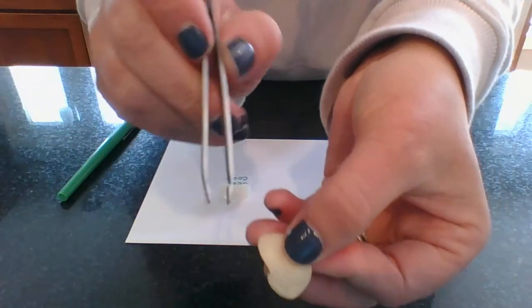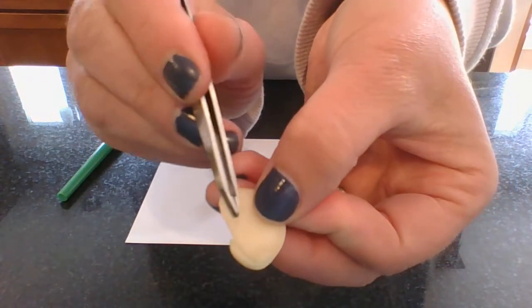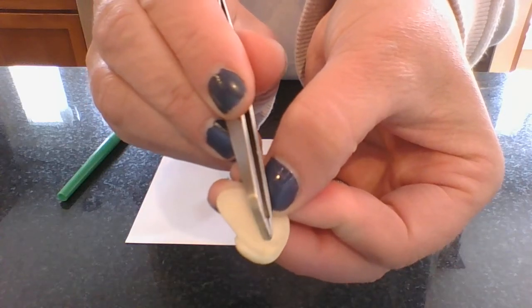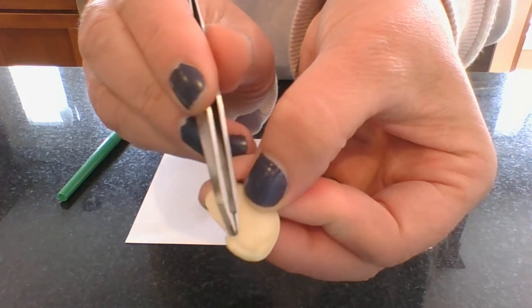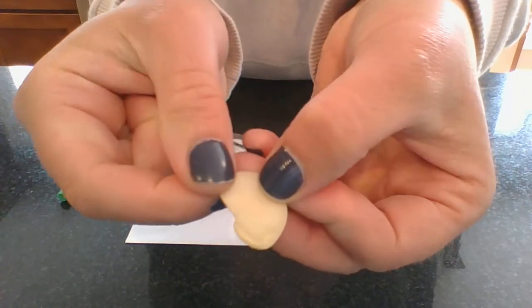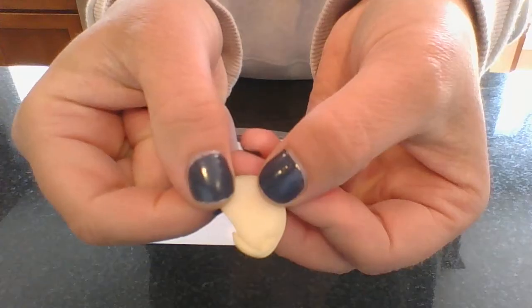And then in here, if you look really close, you see the embryo or the baby plant. This part right here are the roots and right here, that's going to be the first leaf to bud. So that's the embryo or the baby plant.